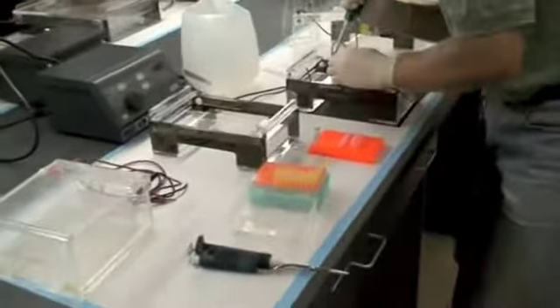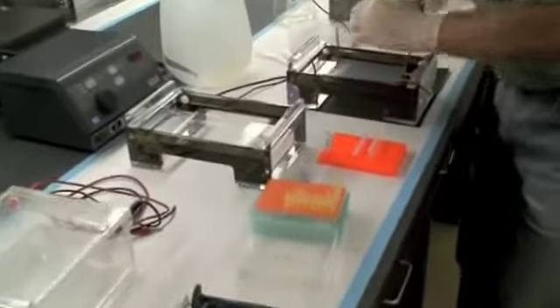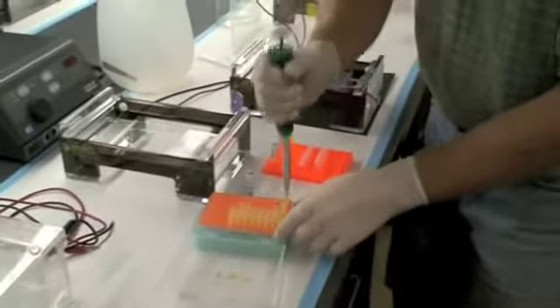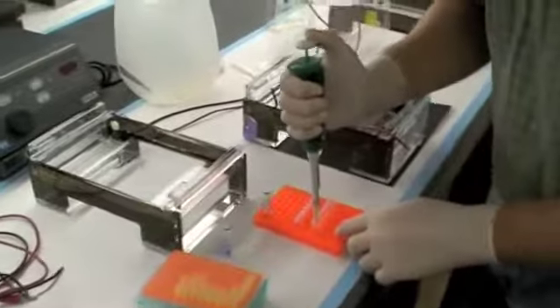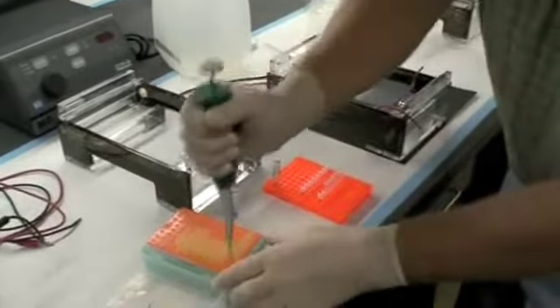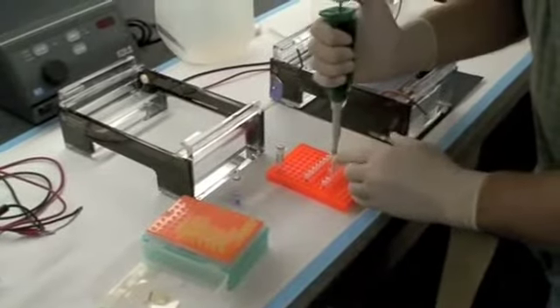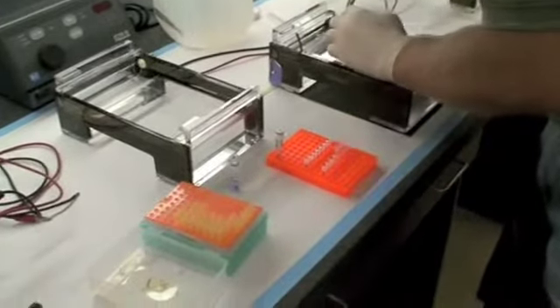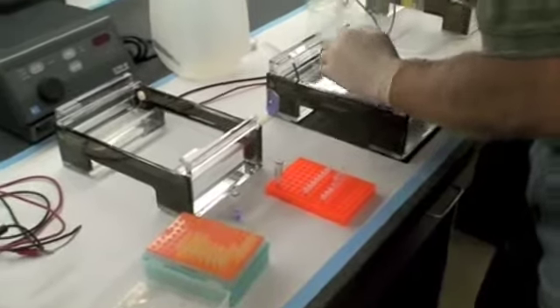In the gel, it's not too hard from my vantage point to see which wells have dye in them. Notice that the wells, or that it starts to diffuse the longer I wait.